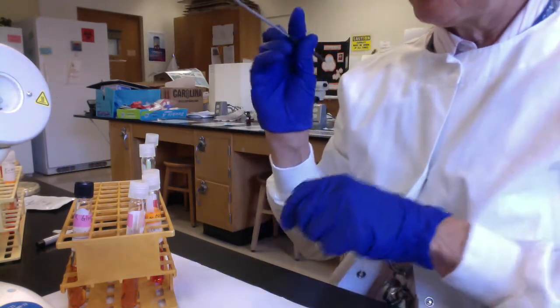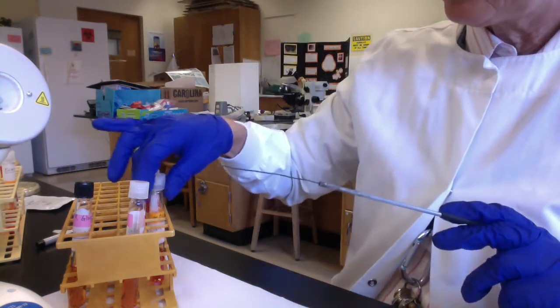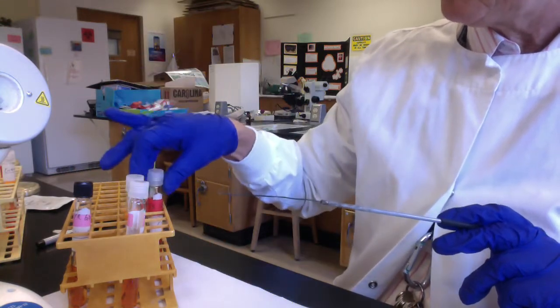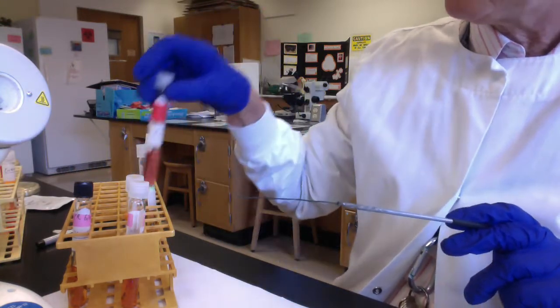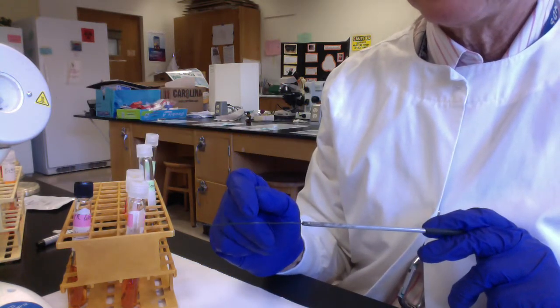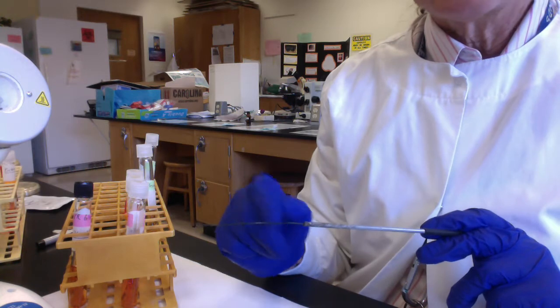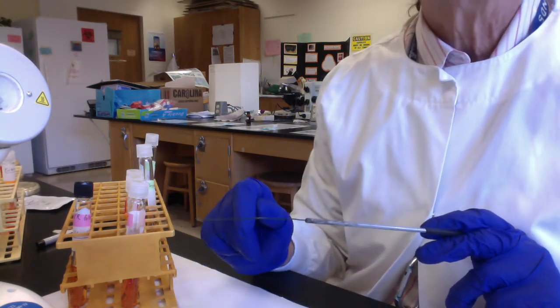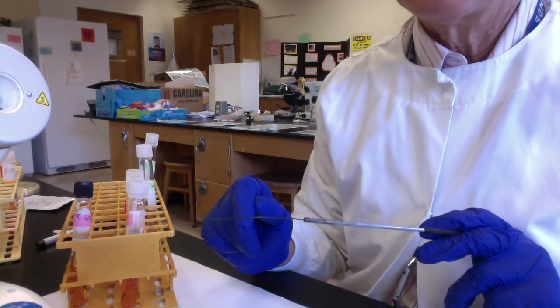And then, folks, I would just repeat that same procedure to inoculate my PR lactose with my E. coli, to inoculate my PR sucrose with my E. coli. And then there will be other microbes that will inoculate, so we can compare fermentation patterns between E. coli and the other microbes.